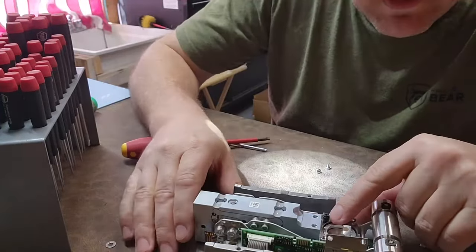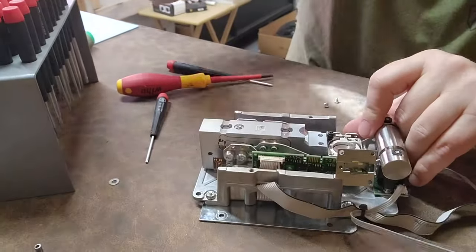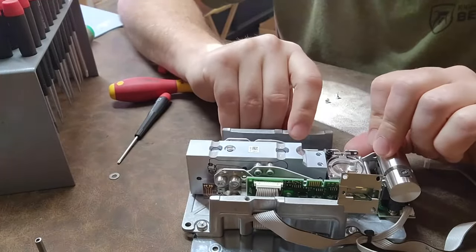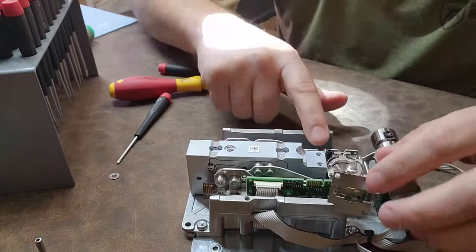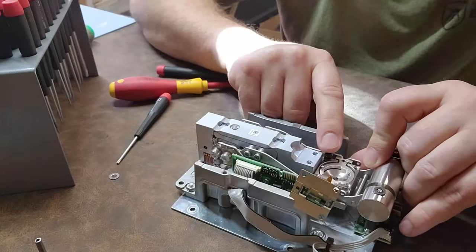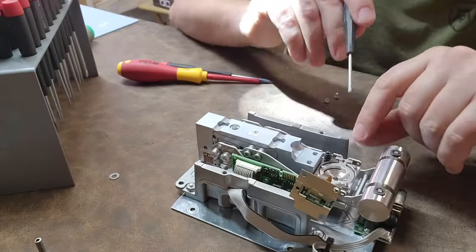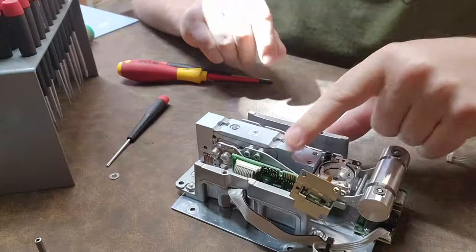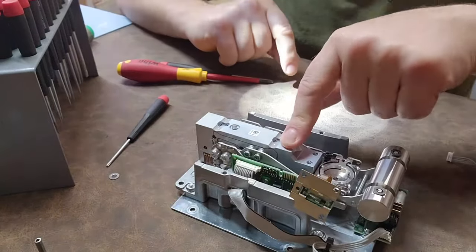You can see there's a calibration screw right here that limits the range of motion. There are so many calibrations — one is for this little arm, and that black screw right there determines when it's out of tolerance. Very cool. That is just for load cell protection — you can see how that tiny gap moves up and down if I barely press on it.